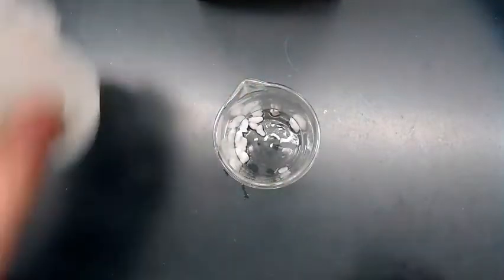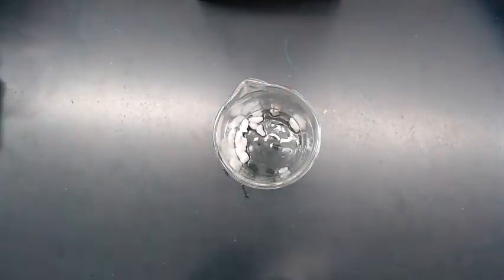Now, the one thing about this is that, let me get the camera a little closer too. One thing about this marble is those little pieces right there. When hydrochloric acid or even any acid goes near it, it's going to start to fizz. And that fizzing is carbon dioxide, and that fizzing is water. Well, that fizzing isn't water, but it's turning into water. And it's also turning those pieces of calcium carbonate, otherwise known as marble, into calcium chloride, and it's actually dissolving in the water. So if I poured enough of this hydrochloric acid into this container with the marble in it, I could dissolve all those little pieces.